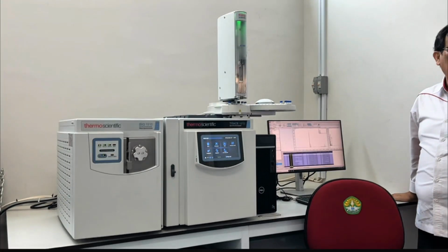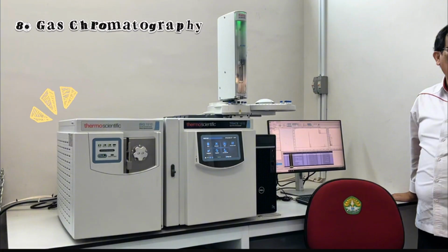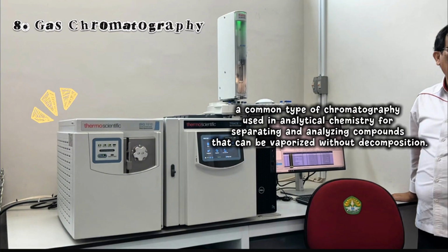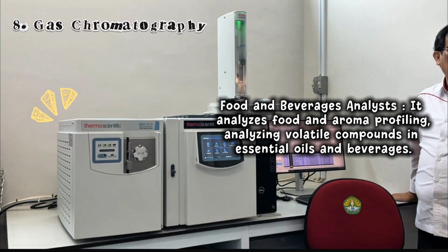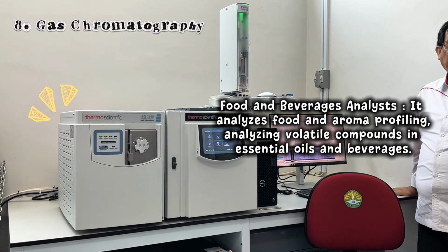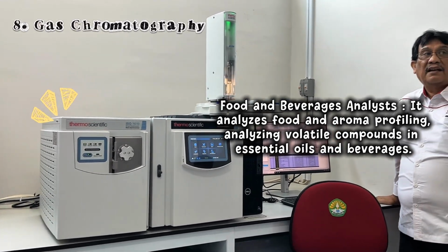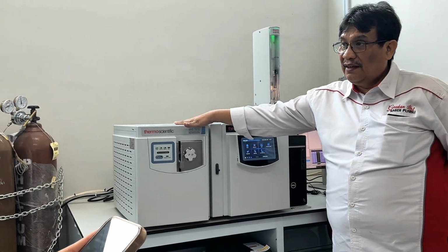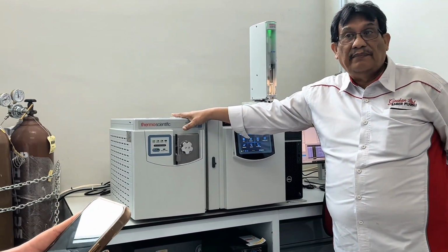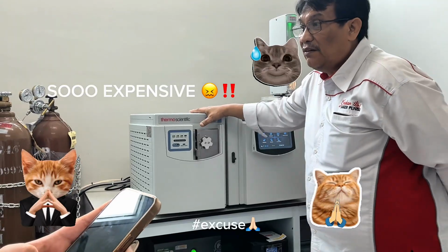Next, they have the gas chromatography, a common type of chromatography used in analytical chemistry for separating and analyzing compounds that can be vaporized without decomposition. One use is in food and beverage analysis: it analyzes flavor and aroma profiling, analyzing volatile compounds in essential oils and beverages. And for your information, the price of this equipment is really expensive.